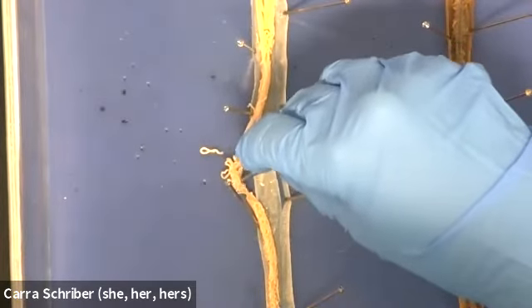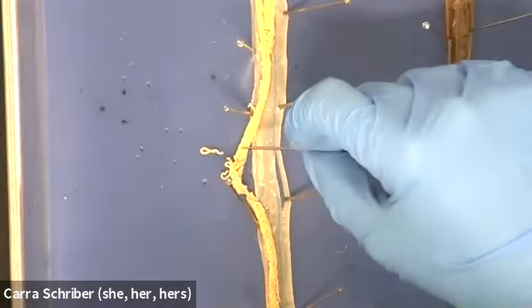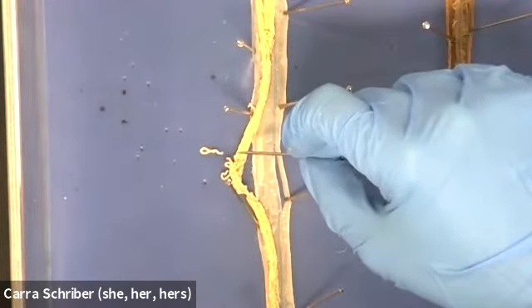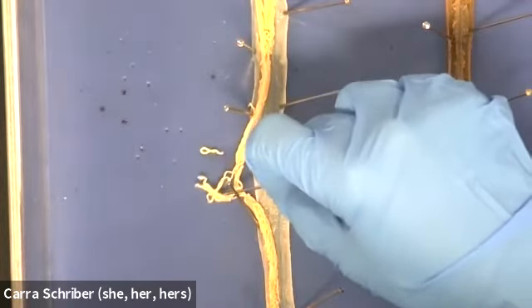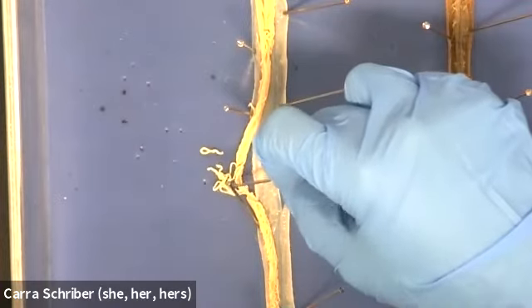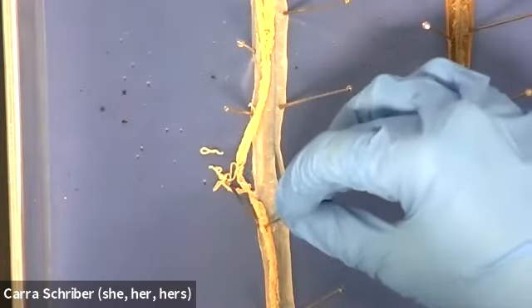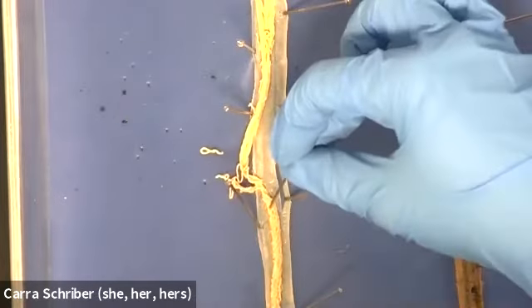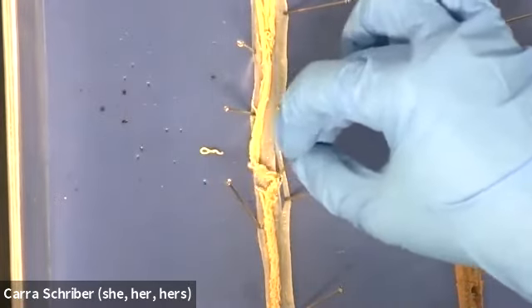This is what happens after the two sides of the uterus end in how large they are. Then they become these string-like bits, and the string-like bits are the ovaries. The ovaries are what actually produce our eggs, and we know what ovaries are. So string-like bits.